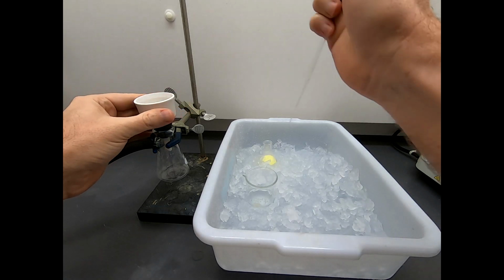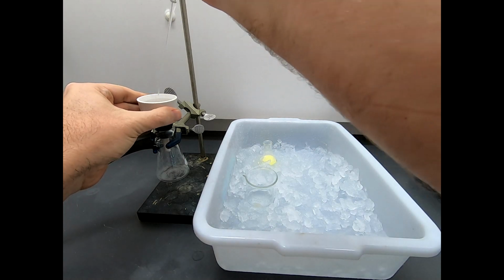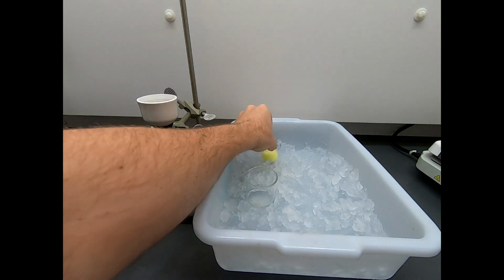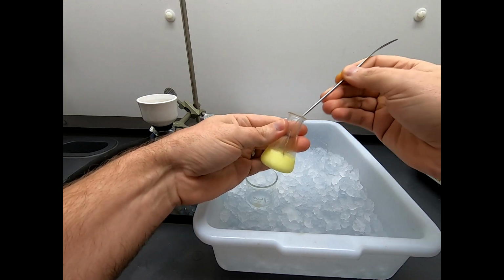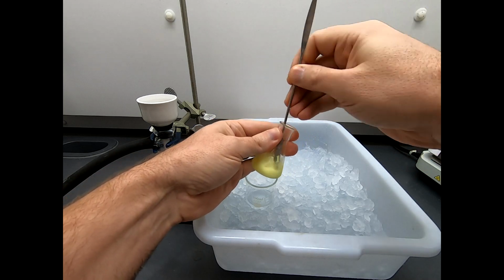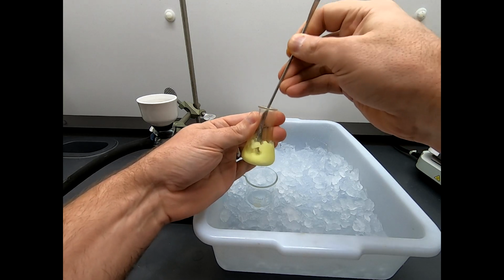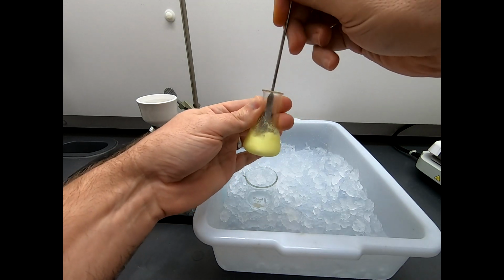And let's use some of this solution to seat our filter paper. There's a little filter paper in there. So that's wet and seated. And now we need to filter this. And this is a little adventure because we're going to have to break this up. This happens sometimes in precipitations. I want to work with this quickly because I've got a hunch that this has pretty decent solubility as it warms up. So let's try to get this broken up quickly.